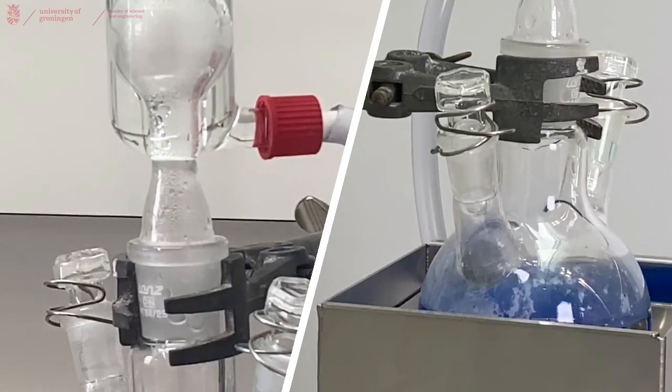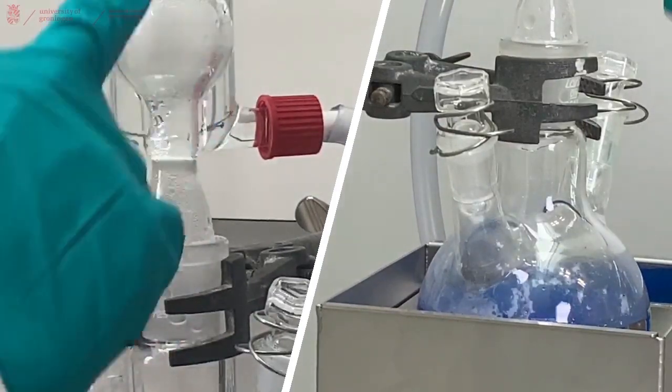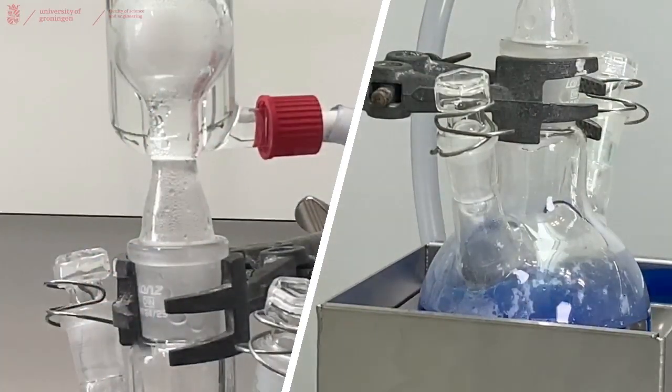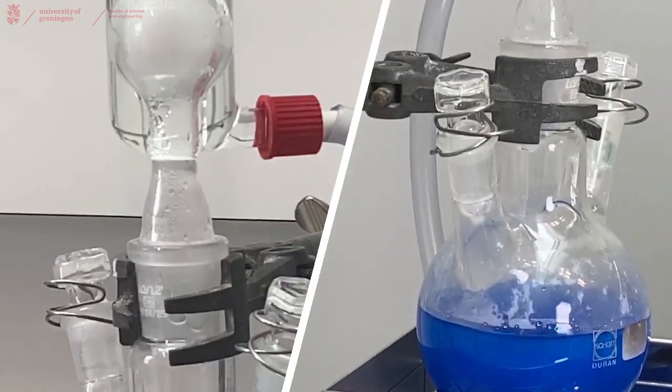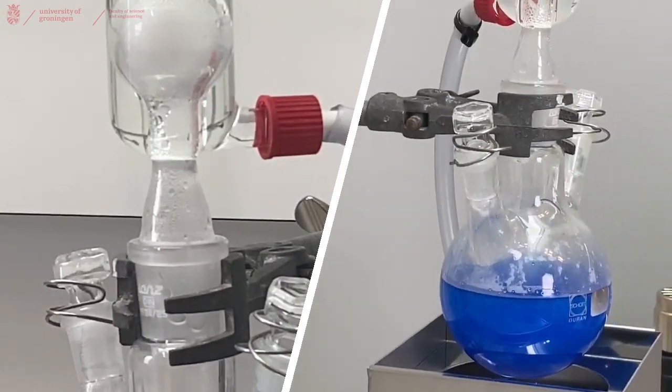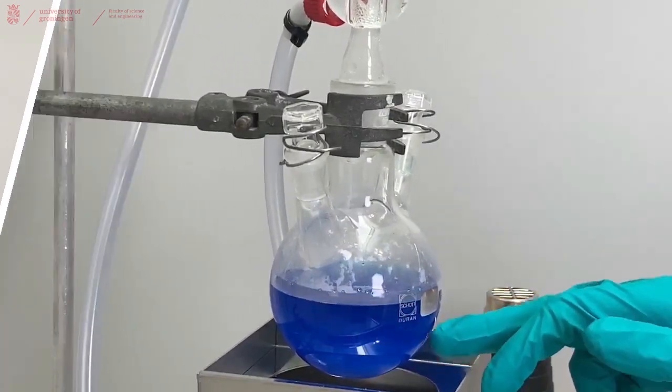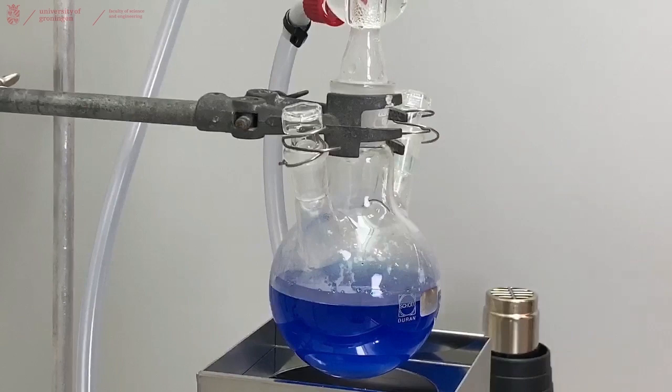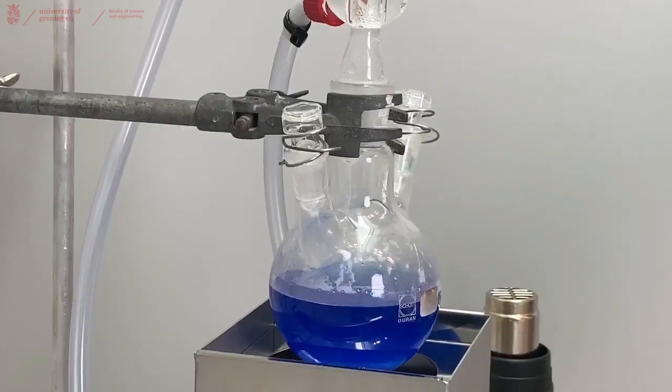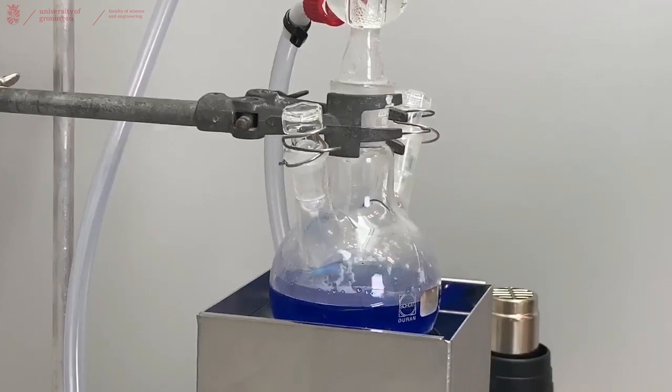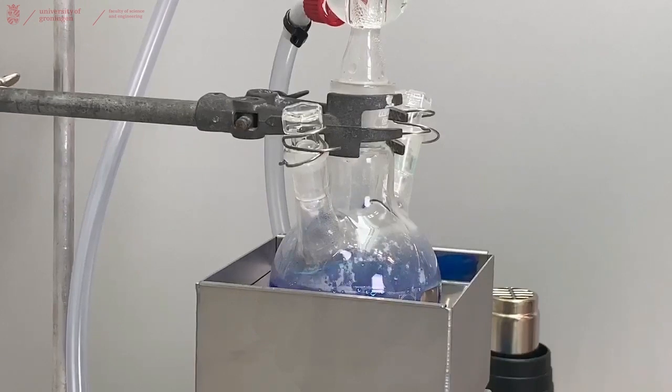So it's been a while now, we've been heating our reaction mixture, we can see the condensation in the cooler. But when we lower our heating mantle, we can see that there's still precipitate or solids in the liquid. So we'll have to add more water to fully dissolve all the copper sulfate. So we'll add that now, then heat it up to reflux again and hope everything dissolves.